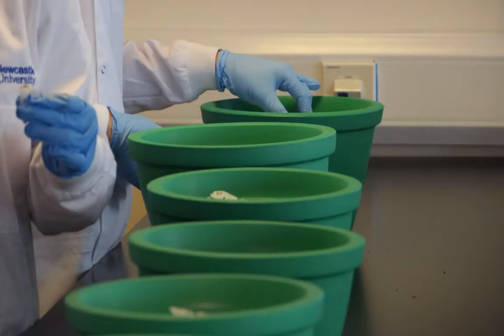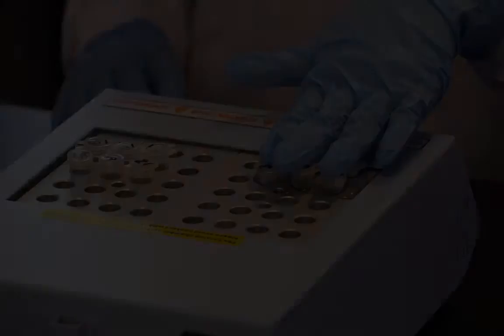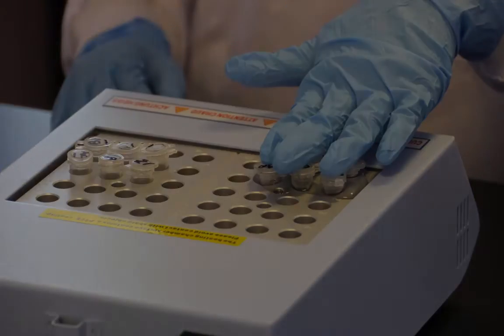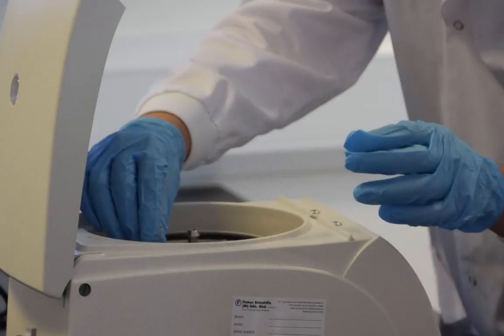The samples were provided on ice and were heated to 70 degrees for 3 minutes before being centrifuged in the lab microfuge.